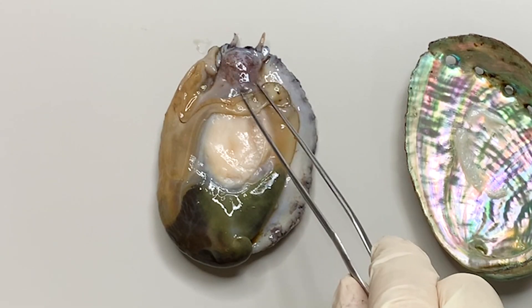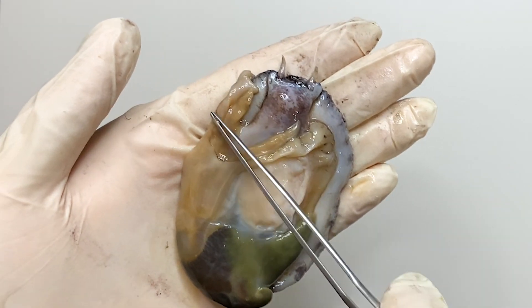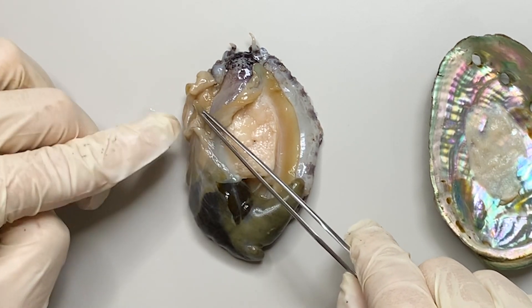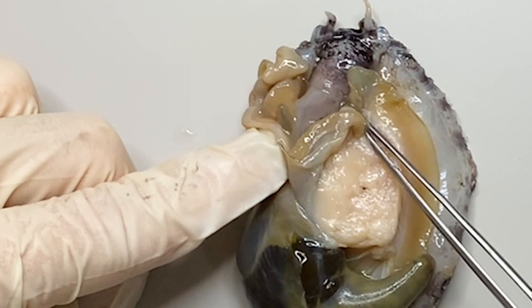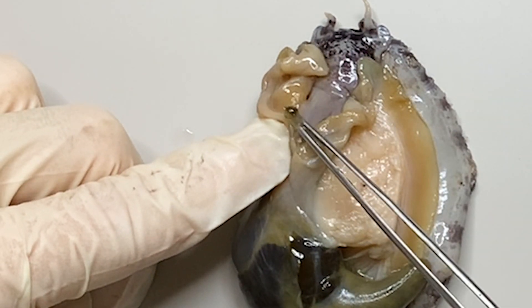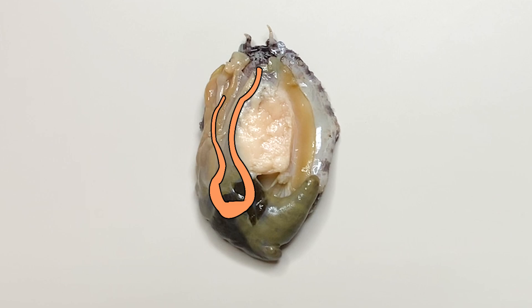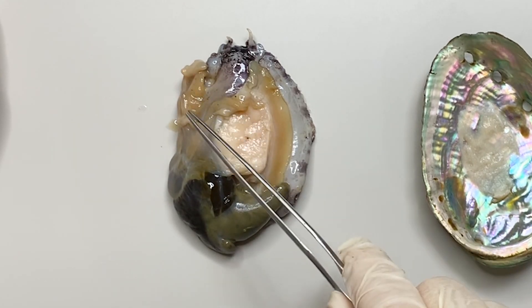This part is the shell muscle of the abalone. Here is the head of the abalone. A pair of gills are located next to the head. And unexpectedly, the anus is located in the inner part under the gills. If you press the upper part of the anus, you can see poop coming out. The digestive tract of abalone runs from the head to the gills, so the anus is located on the side of the head.